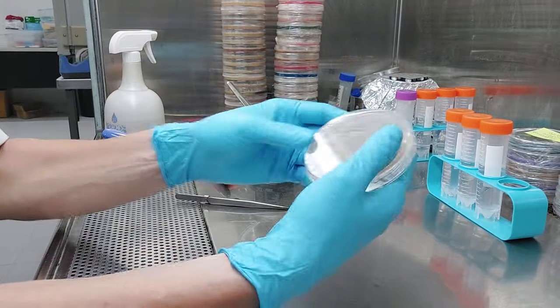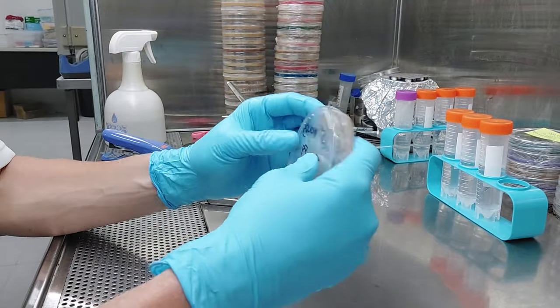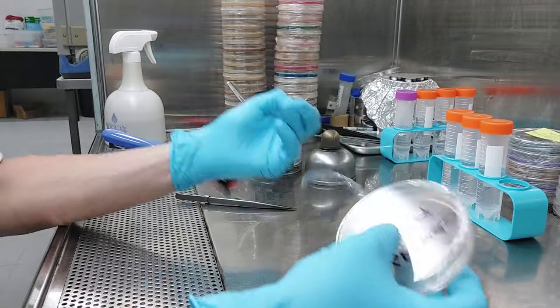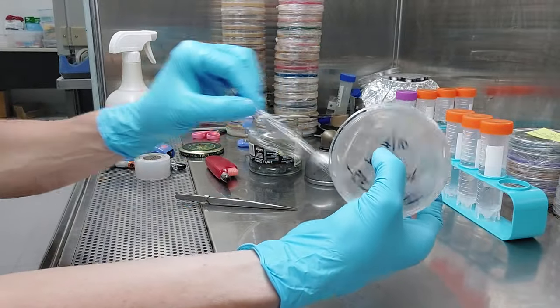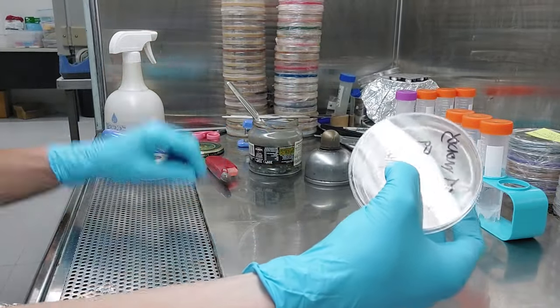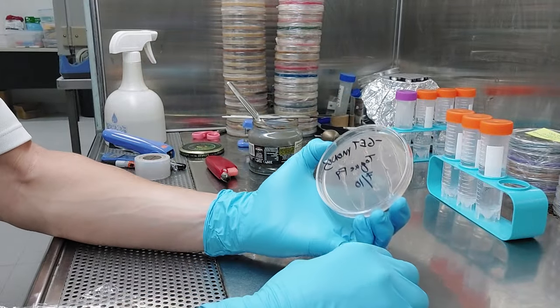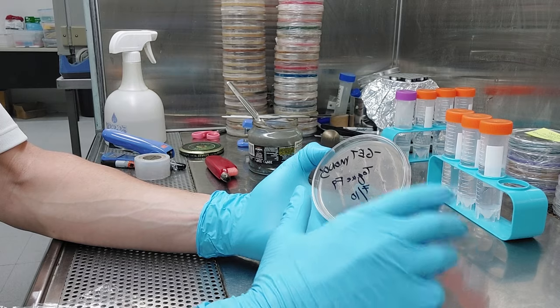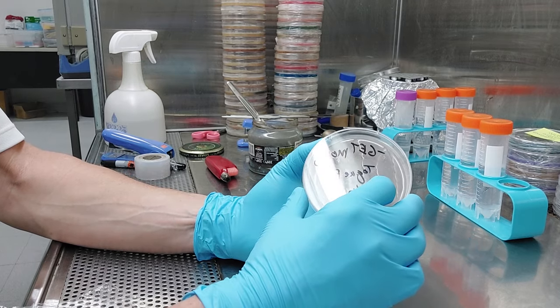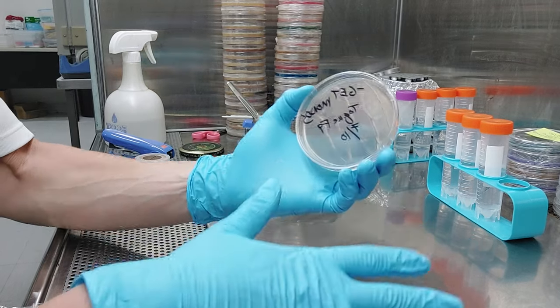Now what has happened is three days later I have, see this you guys, cling film, see how easy that is. I've already pulled monos off this, so this is why I don't have the hood on. That's why the sound quality is so much better.